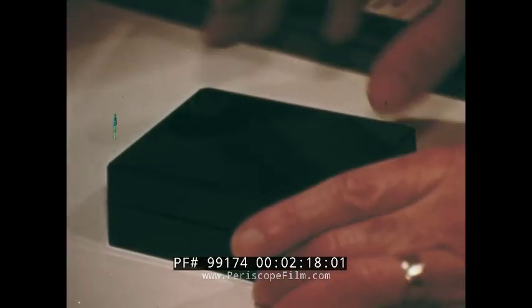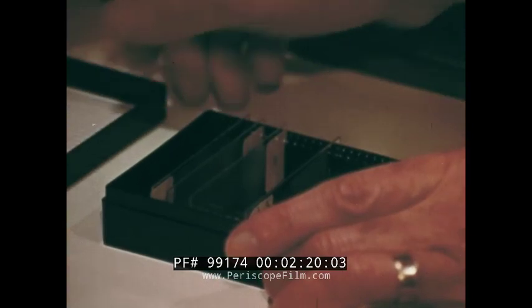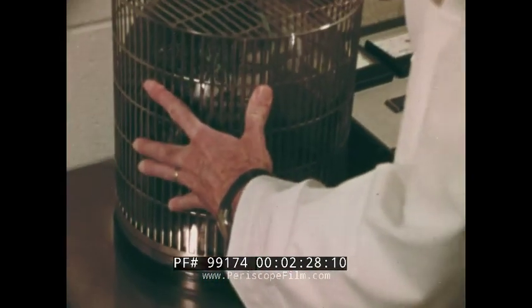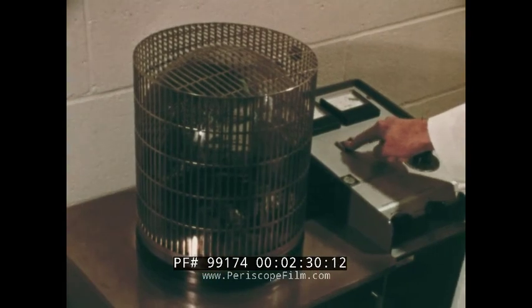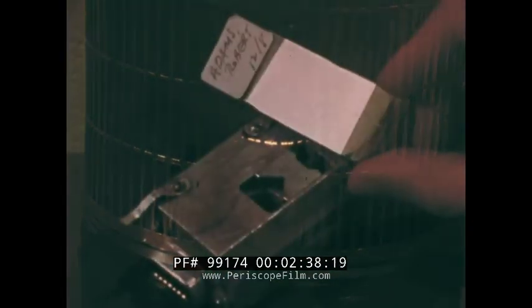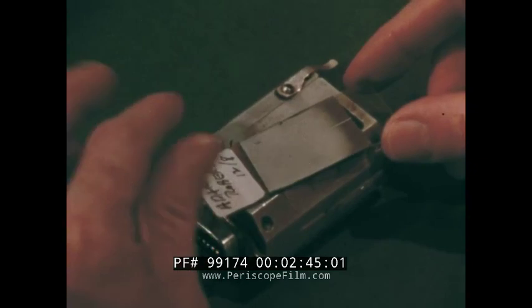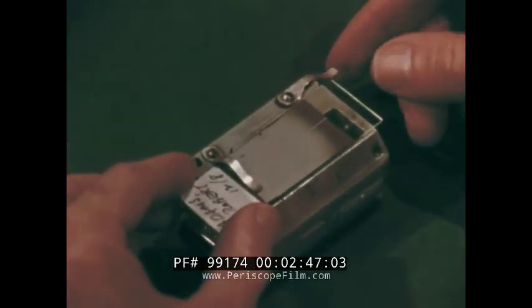The preparation of a blood smear for examination on the scanning electron microscope is fairly rapid and simple. First, the slide is put into a vacuum evaporator, where it is coated with a very thin layer of gold, no more than a couple of 100 angstroms thick. Biological materials conduct rather poorly. This treatment makes the surface electrically conductive, so it's ready to be scanned by the moving electron beam of the scanning electron microscope.